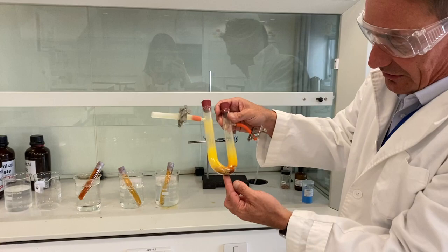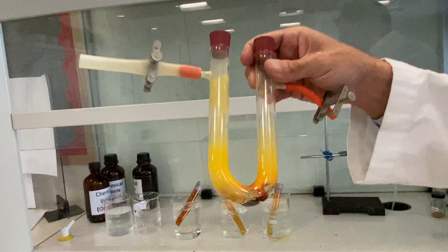Now, what we're going to do here, we've got, you can see, there's some brown liquid there, look, and you can see we've got a lot of yellow solid there, okay.